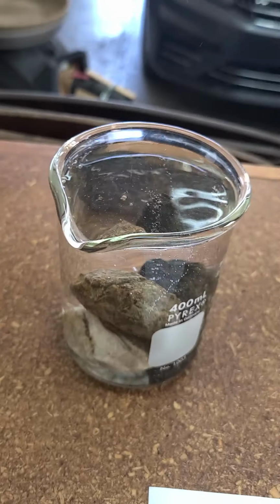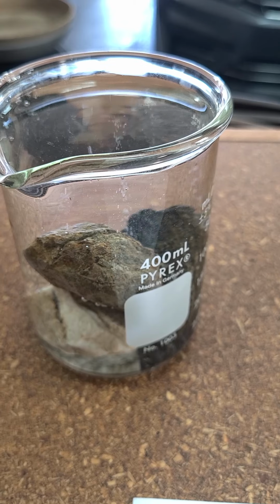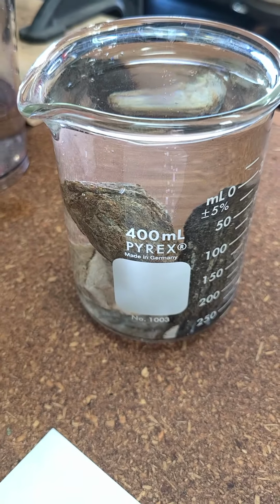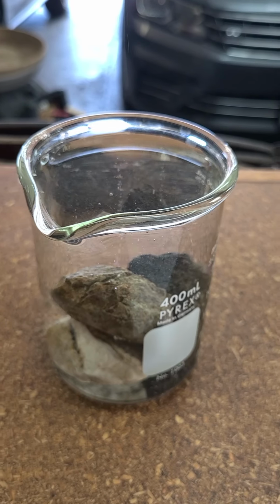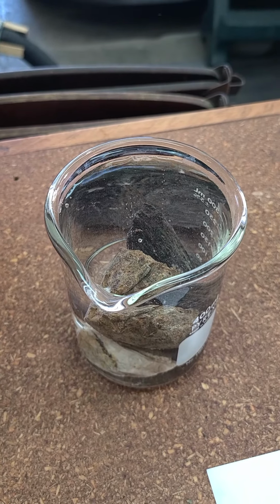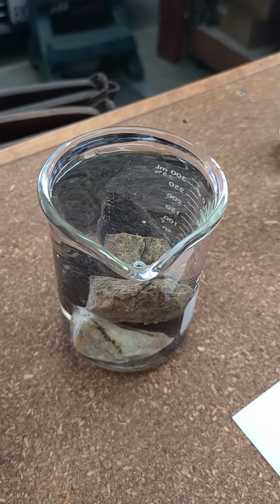And you can kind of see something interesting is going on already, right? Got all this bubbling. What does that mean, do you think? It's just water. Well, that to me indicates that perhaps we've got some porous rocks. Doesn't show as well as I'd like, of course, but definitely you can see the bubbling in it. That's a good sign. You see it maybe a little bit better there. That's a pretty good indication that there's air inside those rocks someplace, and those bubbles are that air being displaced by water.